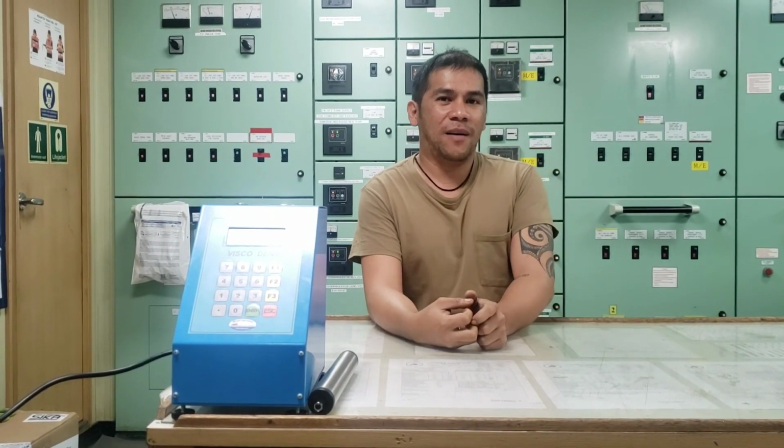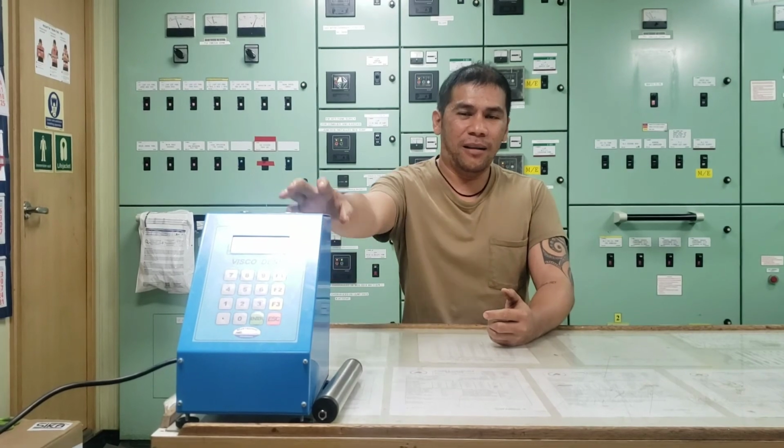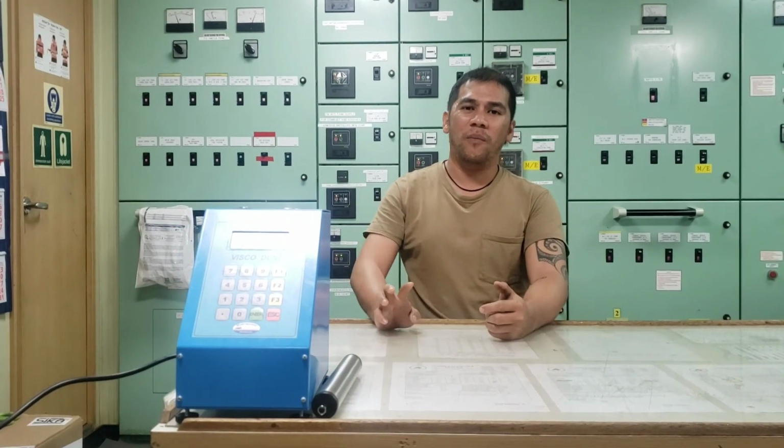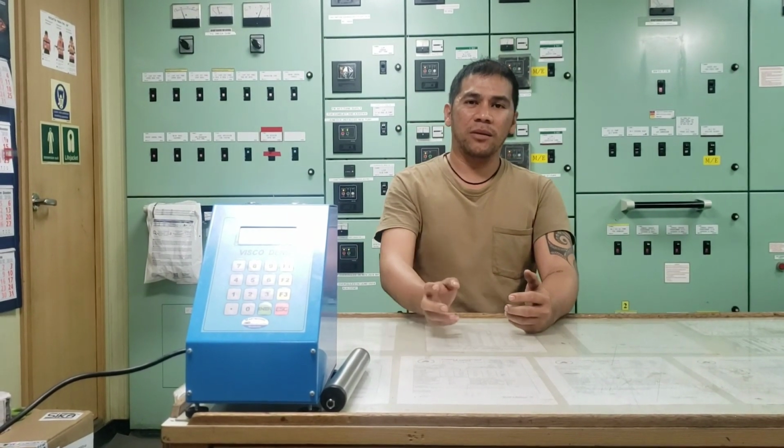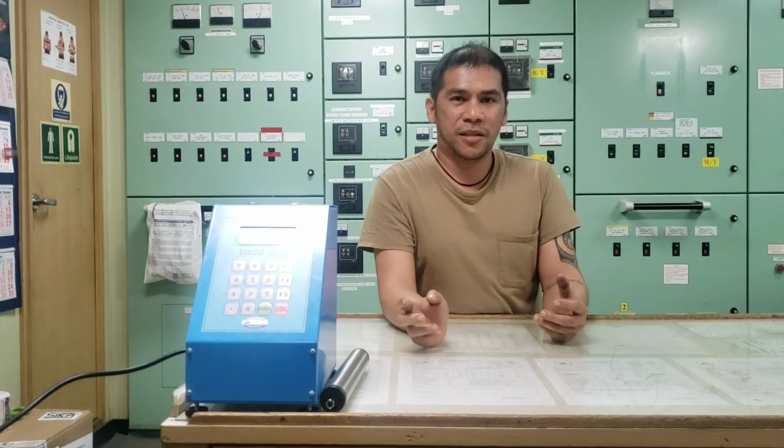Alright guys, that's it for today. I hope you have some knowledge on how to take viscosity on this equipment.